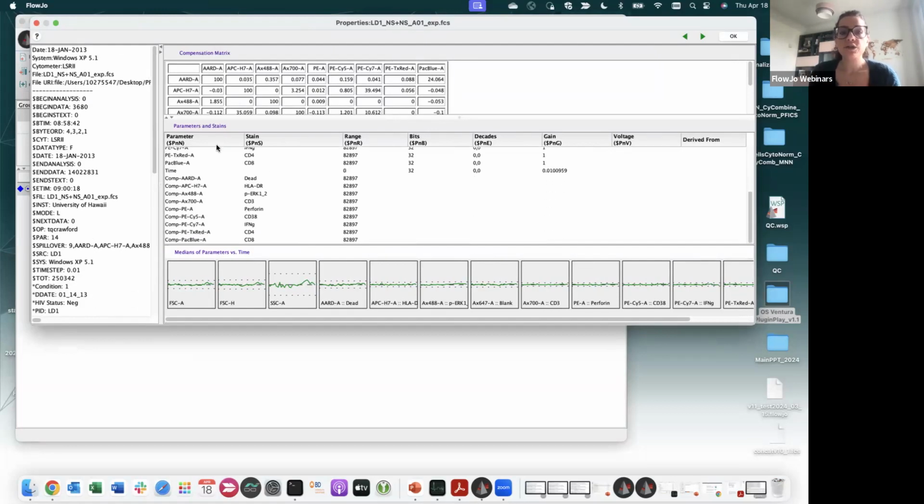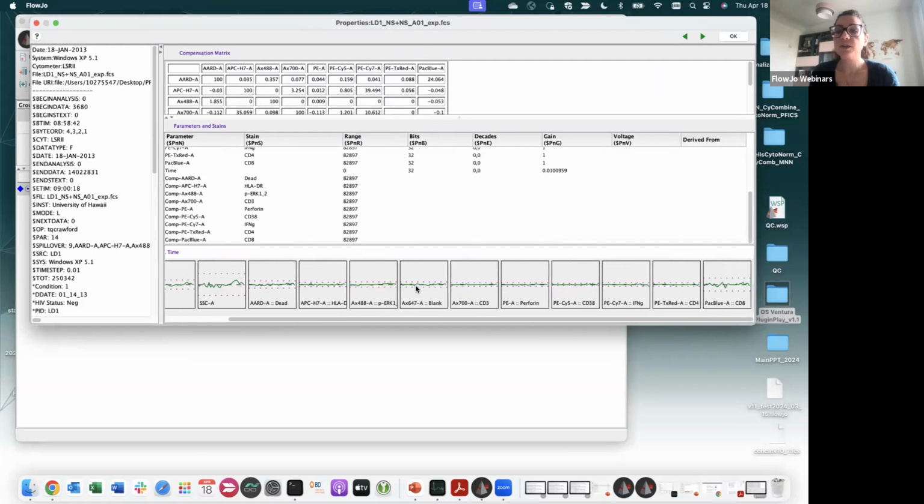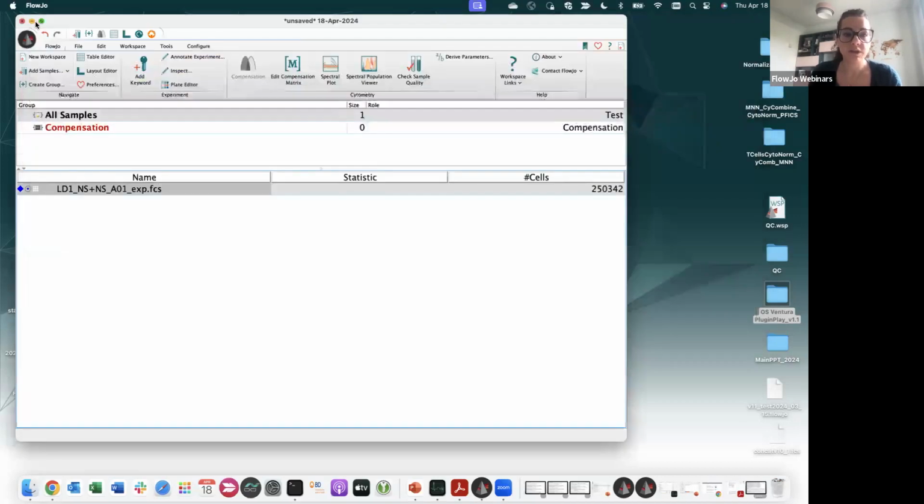You will have information regarding the parameter names and stains, and right here you will see the median of each parameter versus time. And as you can see, each value right here, each line, let's say these green lines, are all included within 2 standard deviations. So FlowJo assumes that the quality of this sample is actually good. And this is the default way that you have available within FlowJo.